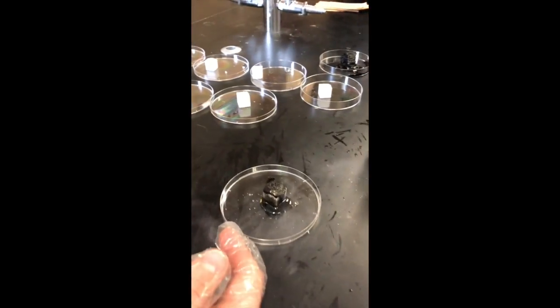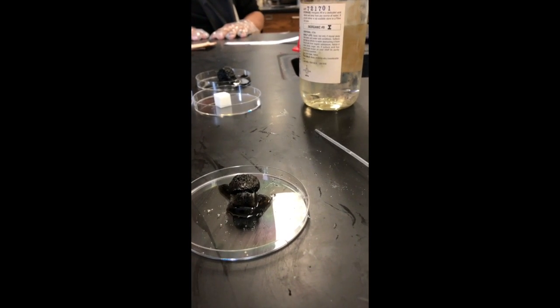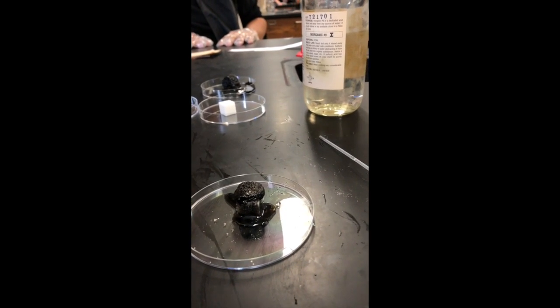Oh, it's smoking. Yeah, it's smoking. Okay, it's smoking. So now you've seen the reaction. Now you have to ask yourself, is that a chemical or physical change? Chemical. That's a chemical. Okay, thank you.